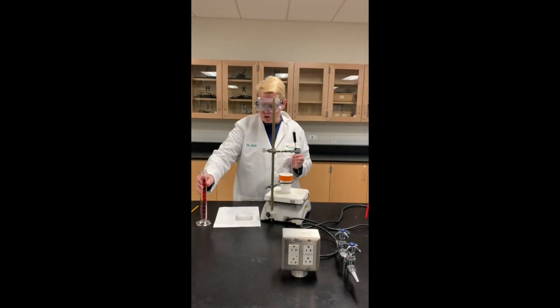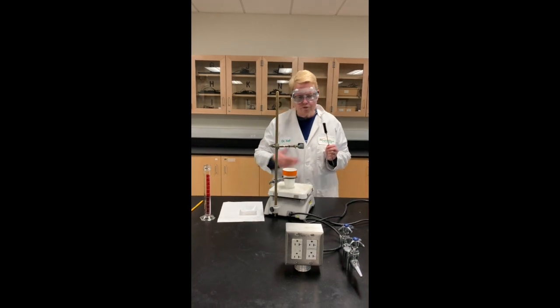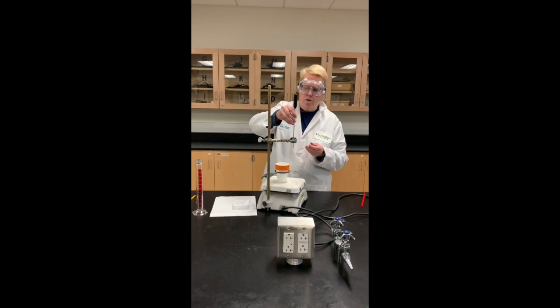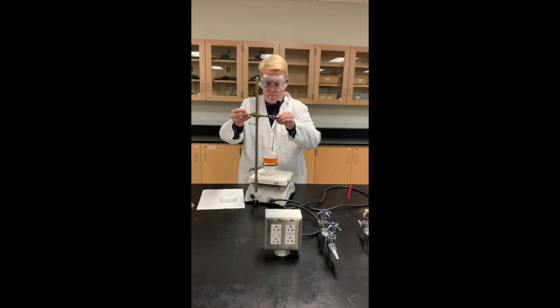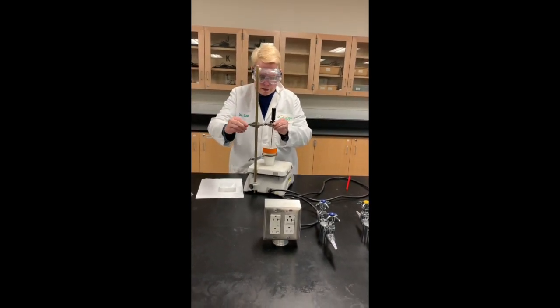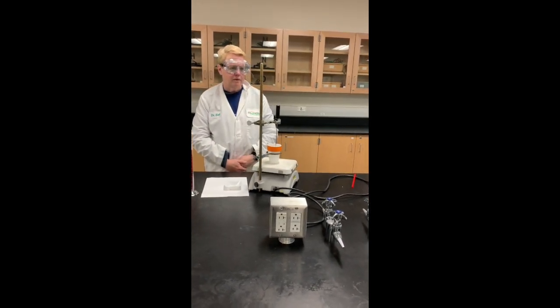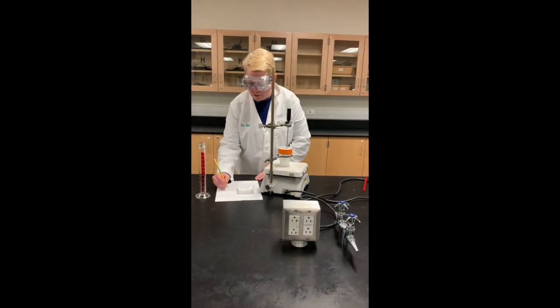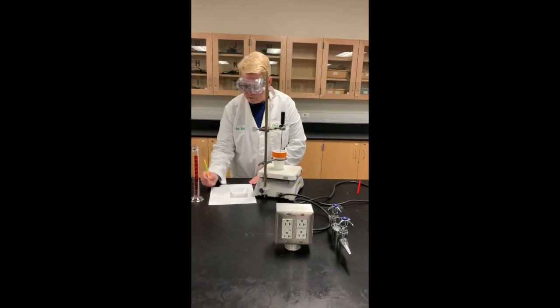Now we want to start it stirring, so you turn on the stir motor and it will continuously stir the solution. We have our thermometer and I'm going to put it through a one-hole stopper so that it will hold in place and not touch anything inside the cup. We lower that down and take an initial temperature, letting it sit for a few seconds to come to equilibrium. We have a temperature of 26.0 degrees Celsius as our initial temperature.